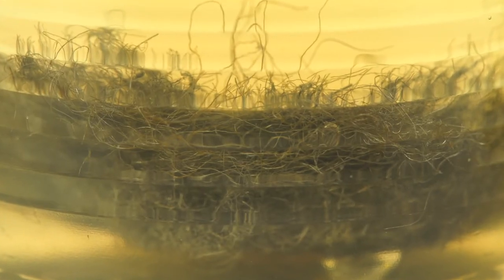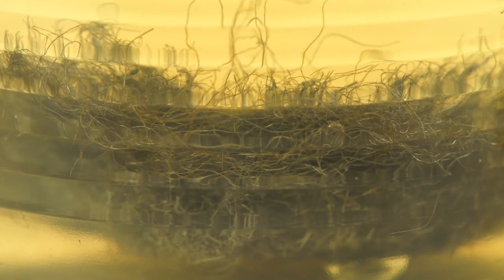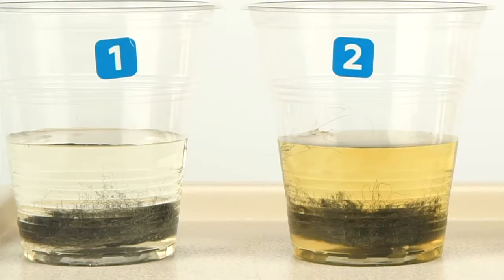The iron in the second cup reacts with the oxygen dissolved in the water, forming rust. Iron doesn't rust in a basic medium, so the iron wool in the first cup will remain unaffected.